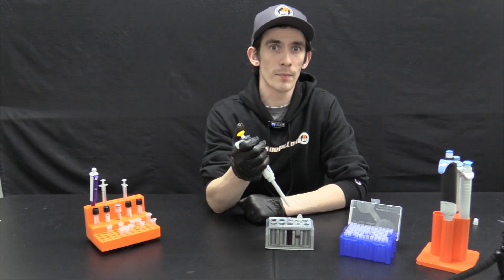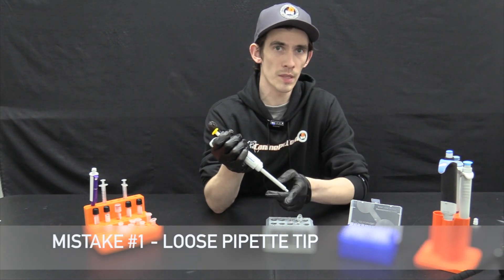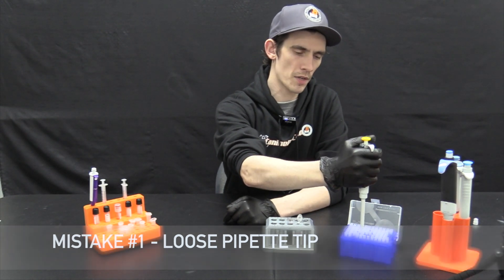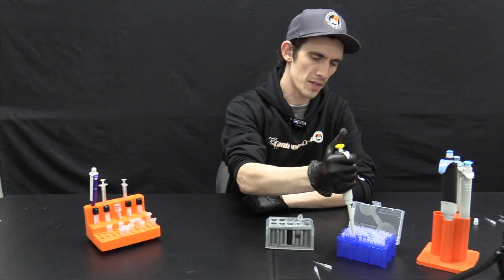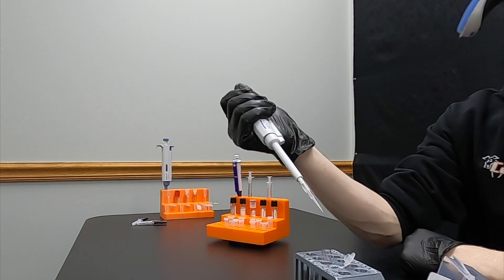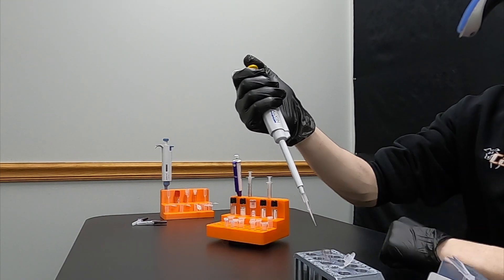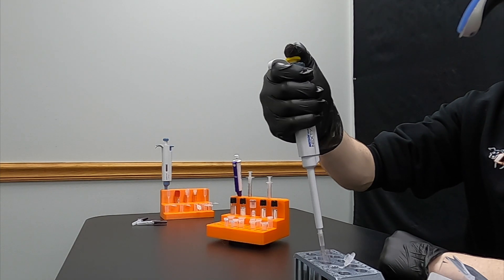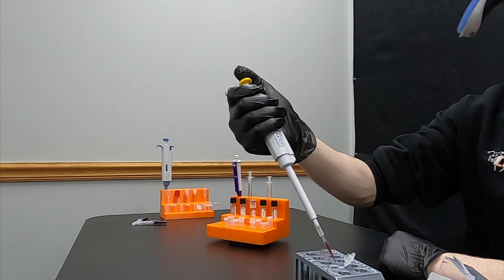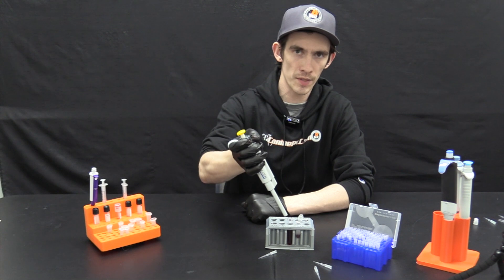Let's demonstrate some of the most common mistakes when using the pipette. The first issue is having a loose tip on the collar of your pipette. This can impact the amount of volume drawn. Placing the tip on loosely — as you can see — causes it to easily fall off. Air seepage through the top, which should form a firm seal, can also result in incorrect volume and invalidate your test results. The tip should not fall off without using the tip eject button.